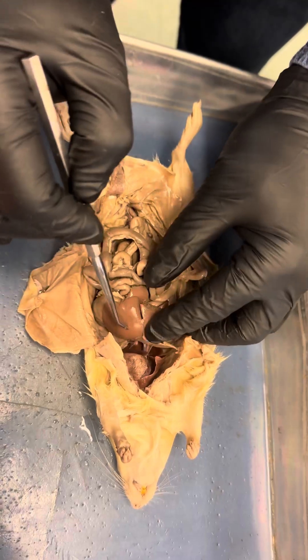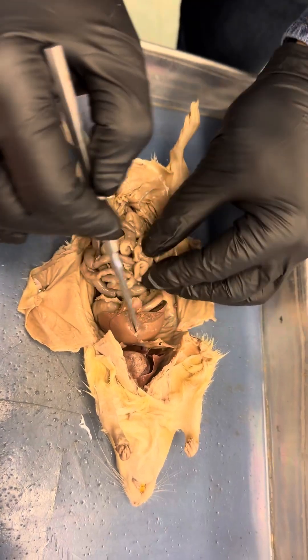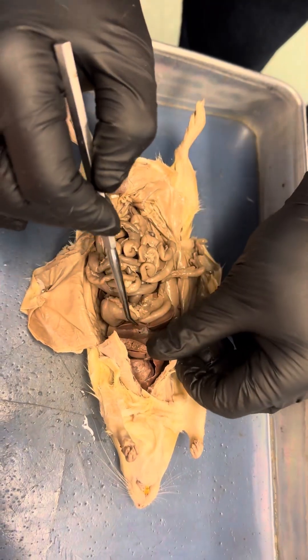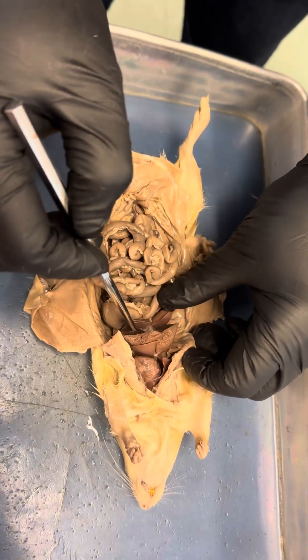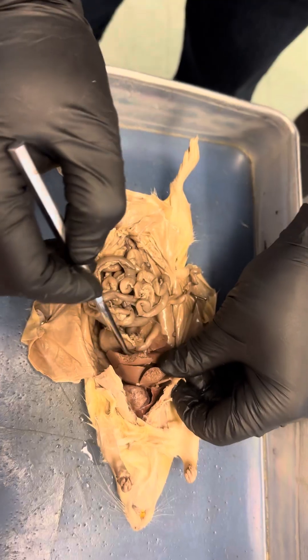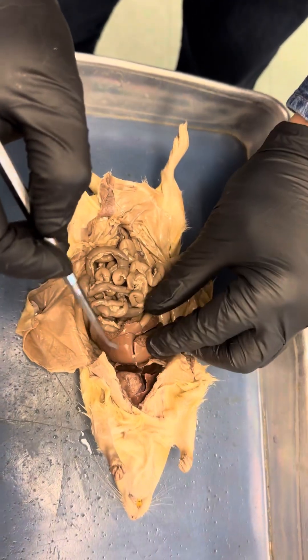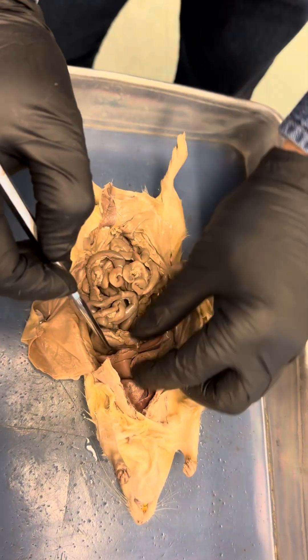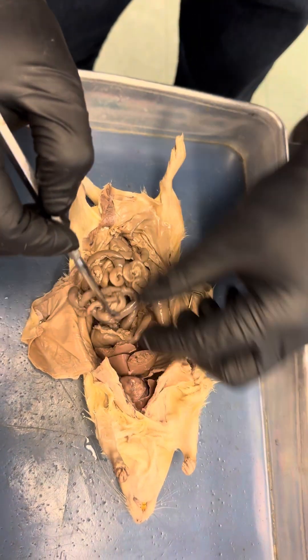And you can see here, this is the liver. Rats don't have a gallbladder. There are different lobes, several lobes, but there is no gallbladder.